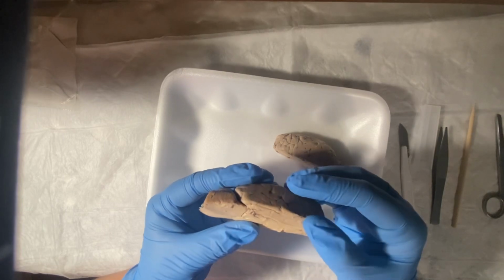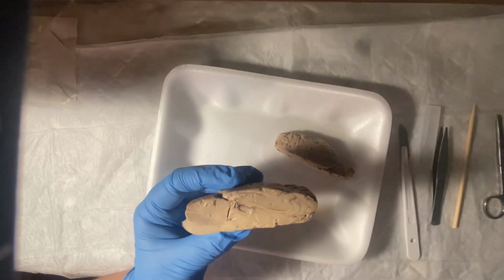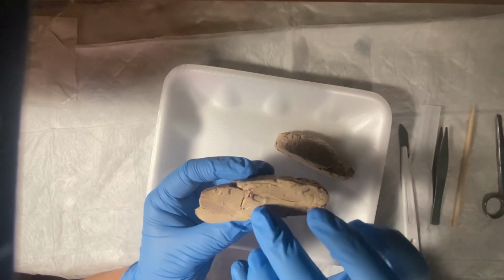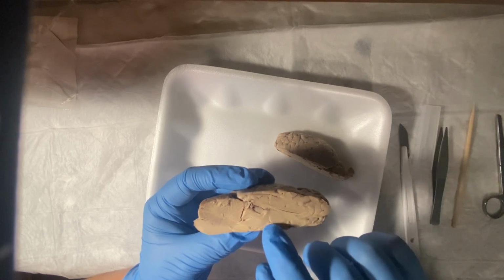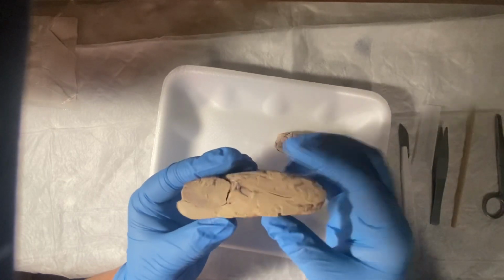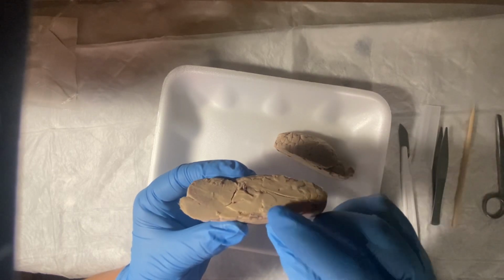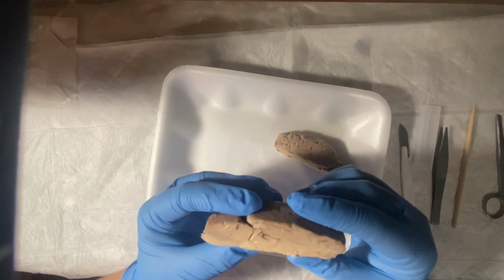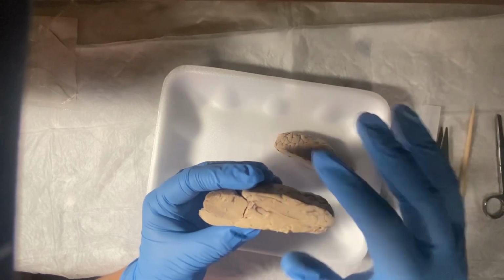So let's find the hypothalamus, which would be under the thalamus, around here, since the thalamus is right here with the optic nerve. So we can assume the hypothalamus is right here. It is very hard to see, but just right here with the optic nerve. Yes, right there.